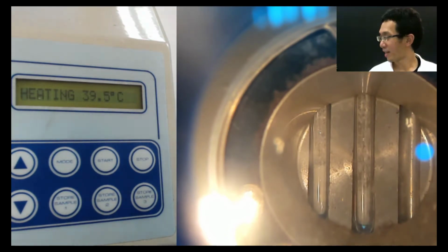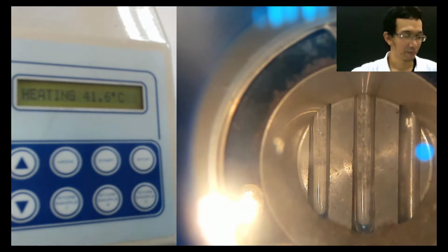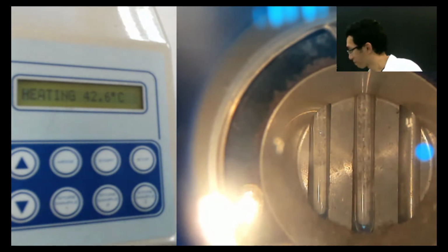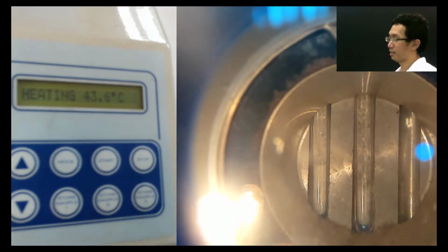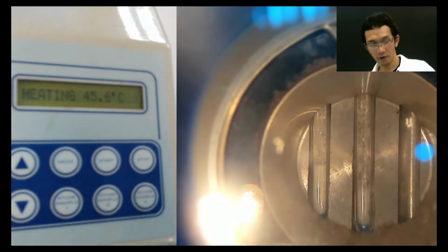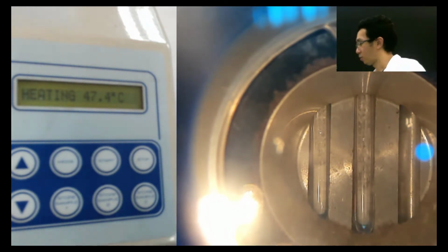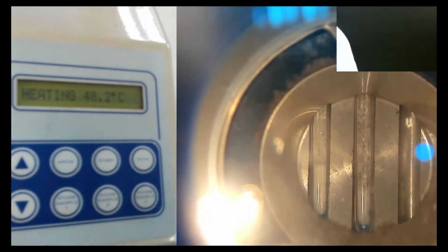So while you are doing that, let me prepare other things. So you do this thing. Whoever gives me the melting point for X and also the melting point for Y, I mean different persons, whoever first tells me that gets marks.